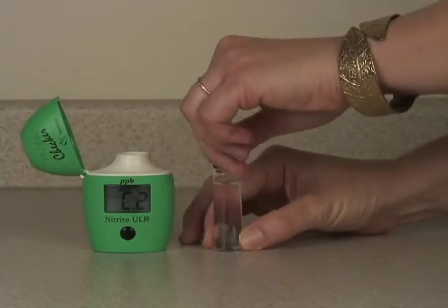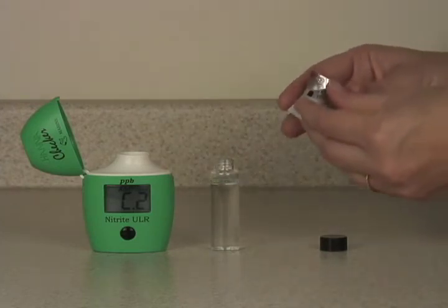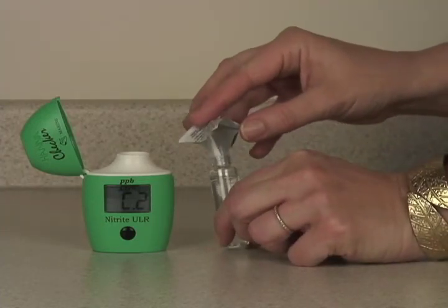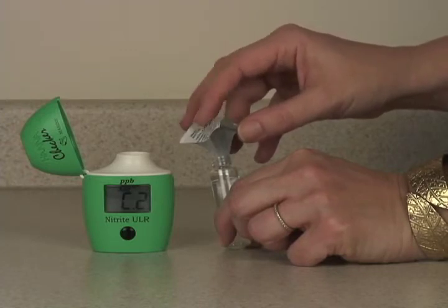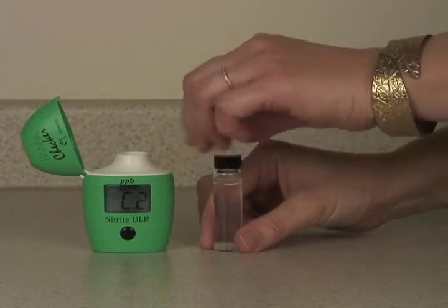Take out the vial, remove the cap, and take your packet of reagent. I've cut off two sides and squeezed the corners together to make a little funnel — it's much easier to pour the reagent in that way. Once it's all in, put the cap back on.